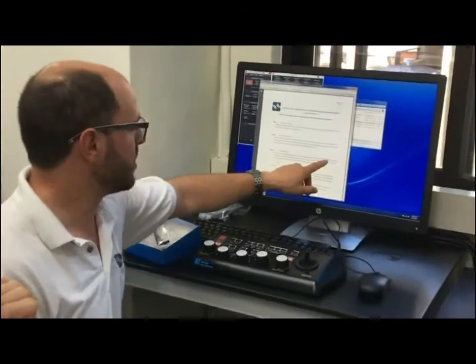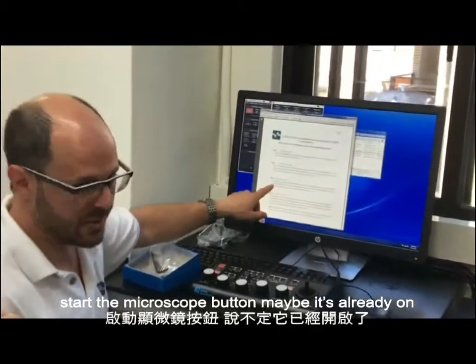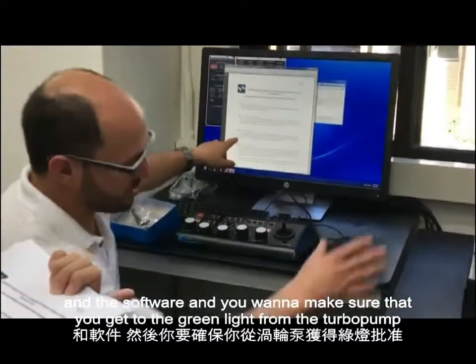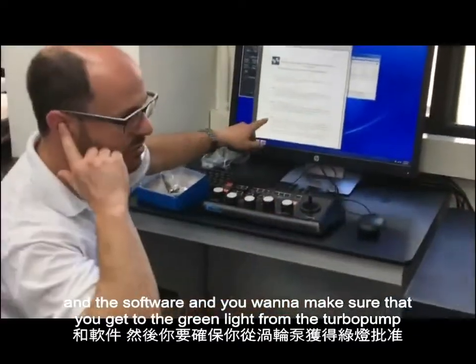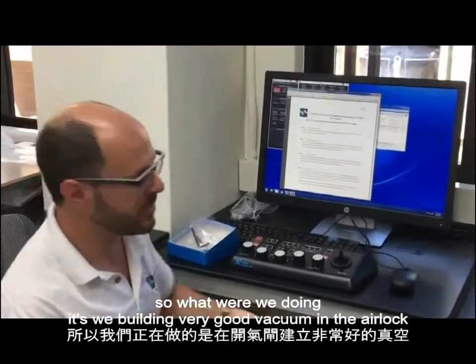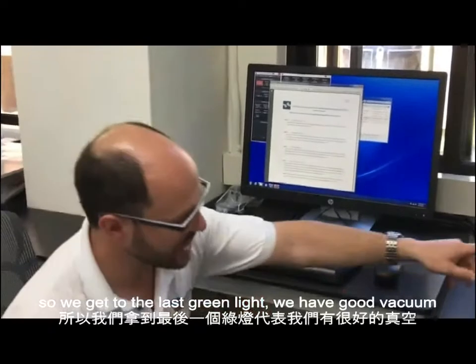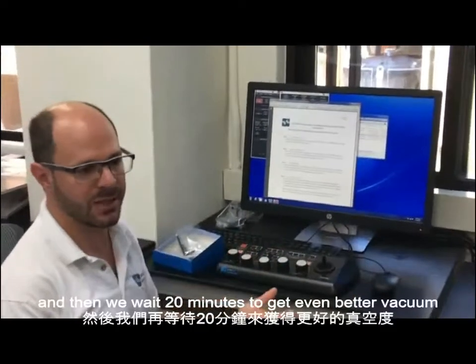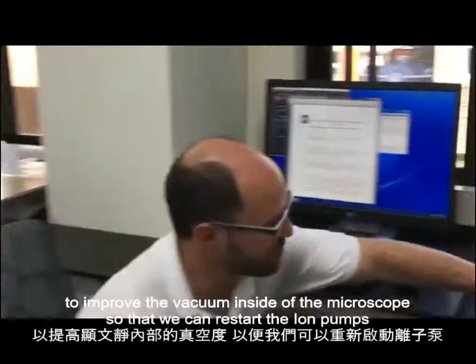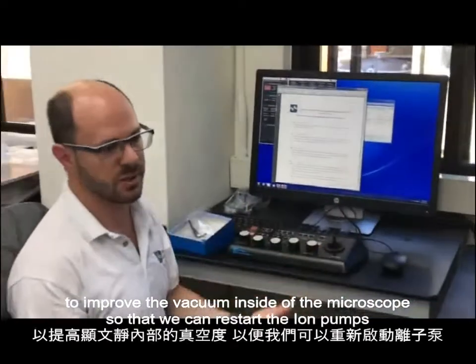Okay? Start the microscope button, maybe it's already on, and the software, and you want to make sure that you get to the green light from the turbo pump, and then you wait 20 minutes more. So what we're doing is we're building very good vacuum in the airlock. Okay, so we get to the last green light, we have good vacuum, and then we wait 20 minutes to get even better vacuum. Because what we're going to do is use the turbo pump to improve the vacuum inside the microscope so that we can restart the ion pumps.